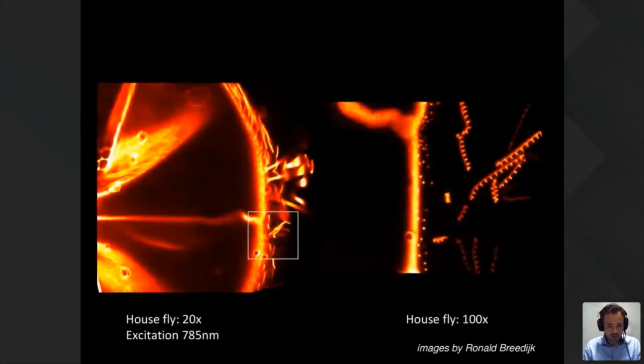And here we see an example of the near infrared RCM. This was some autofluorescence captured at 785 at 20x and 100x magnification. This really nicely shows the level of detail you can observe. And of course, because we have this double sweep going on, we also improve the resolution at these higher wavelengths. The resolution at 785 excitation is about 240 nanometers, which is 40% better than what you would get with other confocal systems at this wavelength.